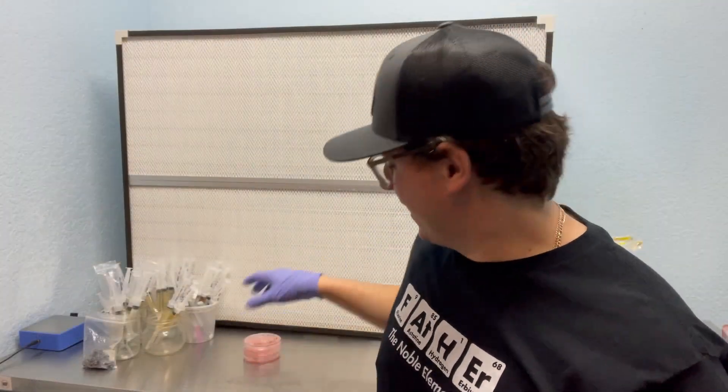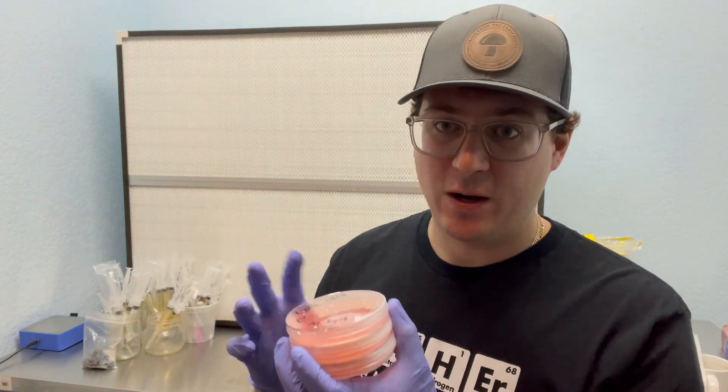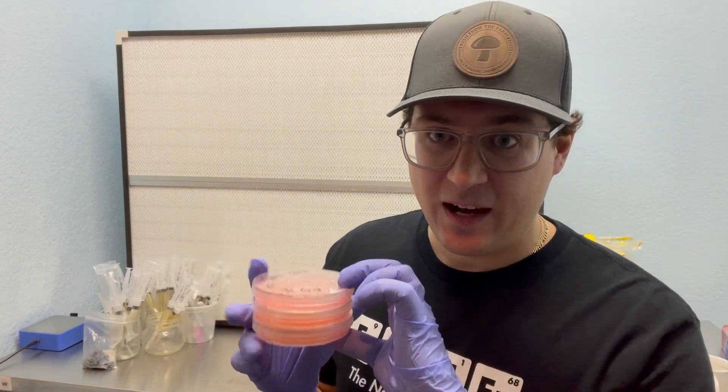All right, so I wrap these up with parafilm and now I'm going to put them in the incubator for seven to ten days. Keep an eye on them before I open them up in my lab with my flow hood so that I can continue working with these prized mycelium cultures. I hope you guys enjoyed that video on how to save contaminated petri dish cultures.